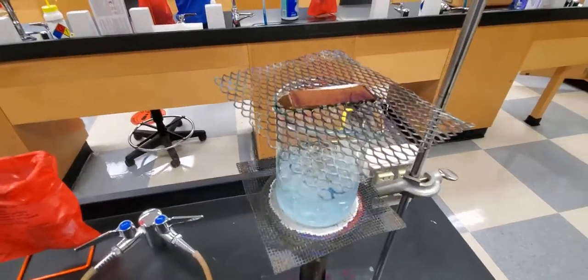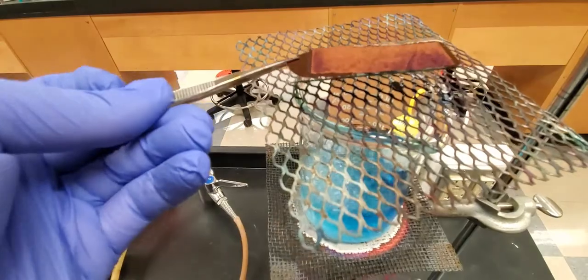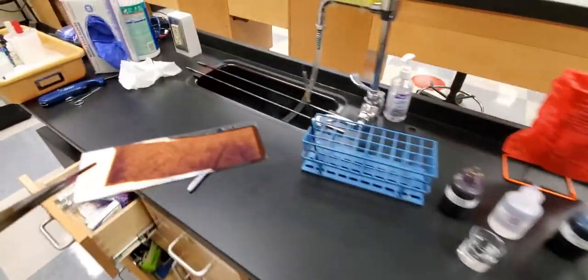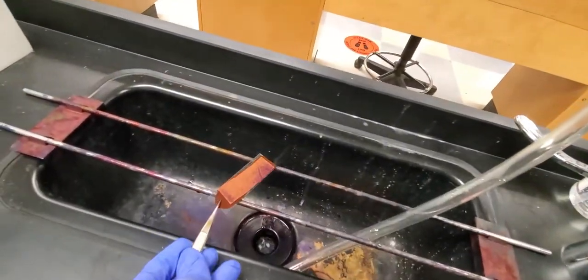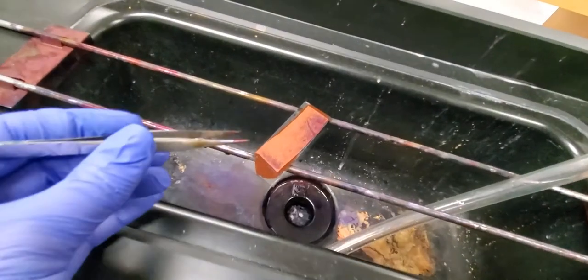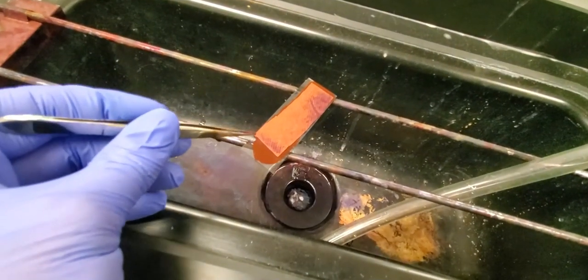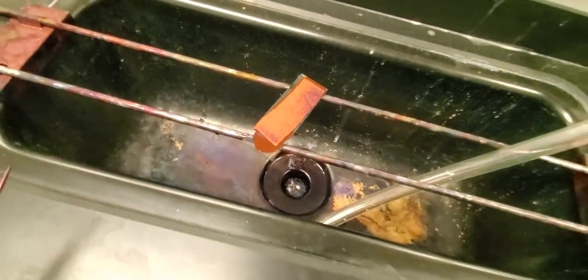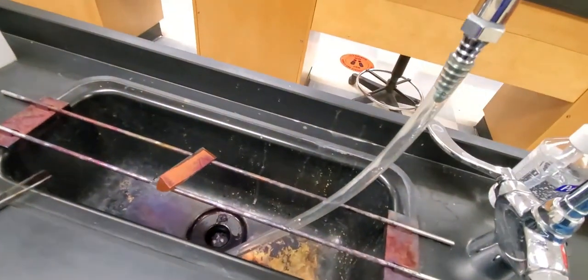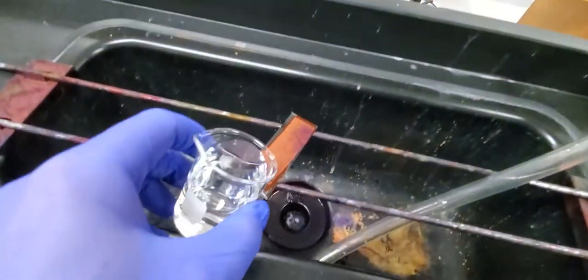We're going to take this endospore stain slide and I'm going to move it over to my sink right here. It's still pretty hot, but what I will do is get some water to moisten this a little bit.